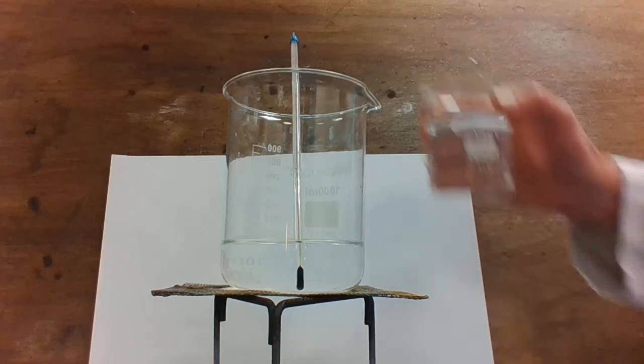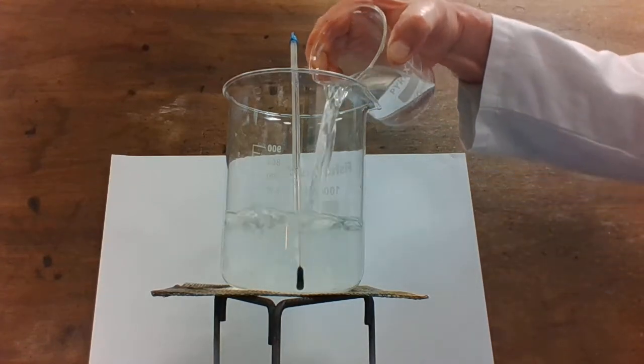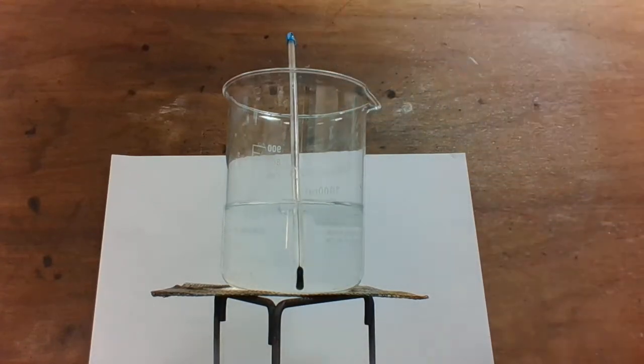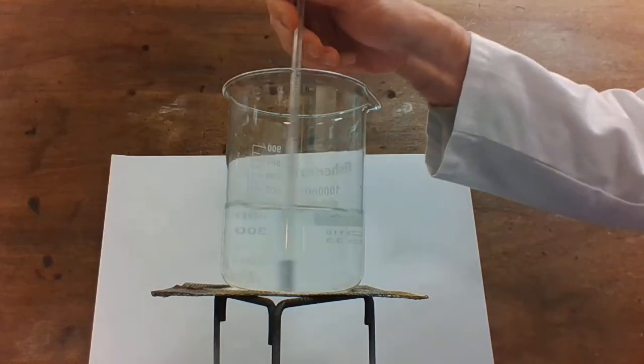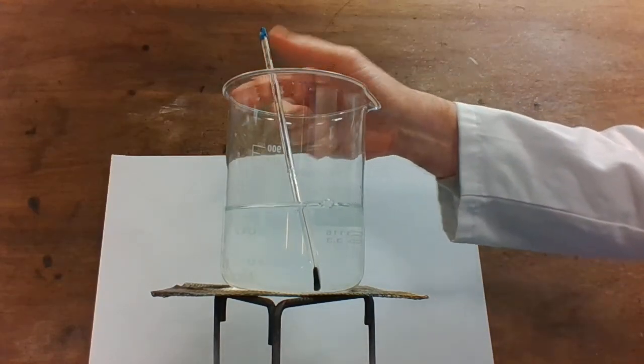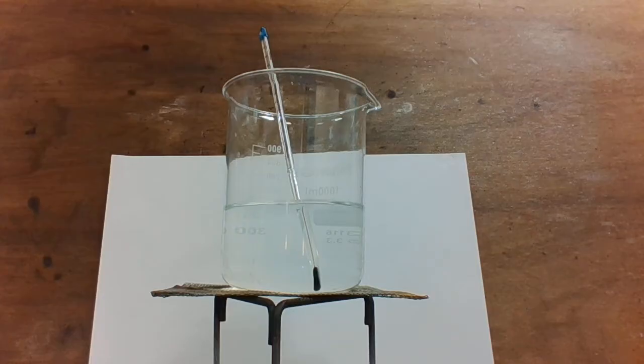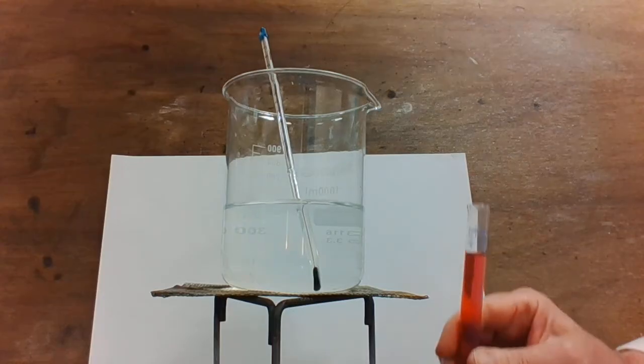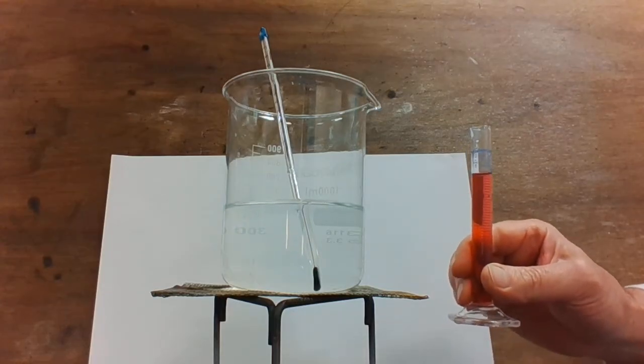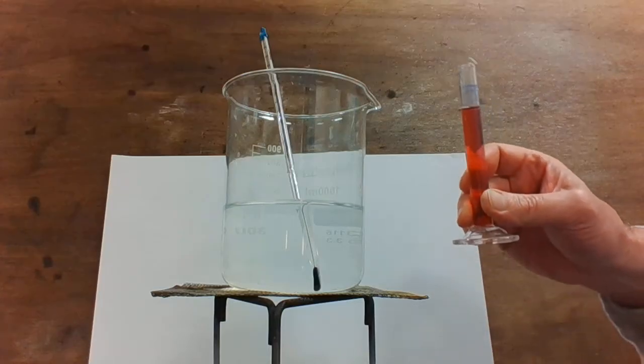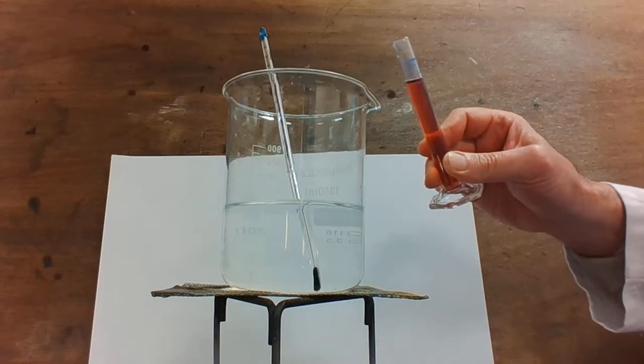When I mix the two solutions together and stir, there is not much evidence of a reaction occurring at the moment. So I'm going to add the catalyst, which is cobalt chloride solution, which is pink. Please observe what happens when the catalyst is added to the solution.